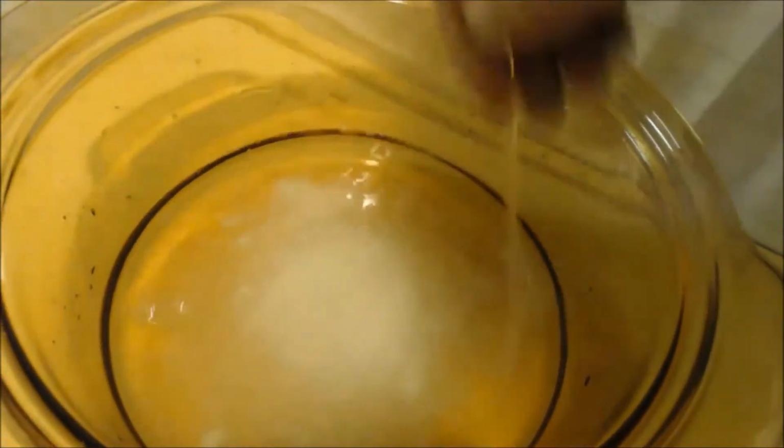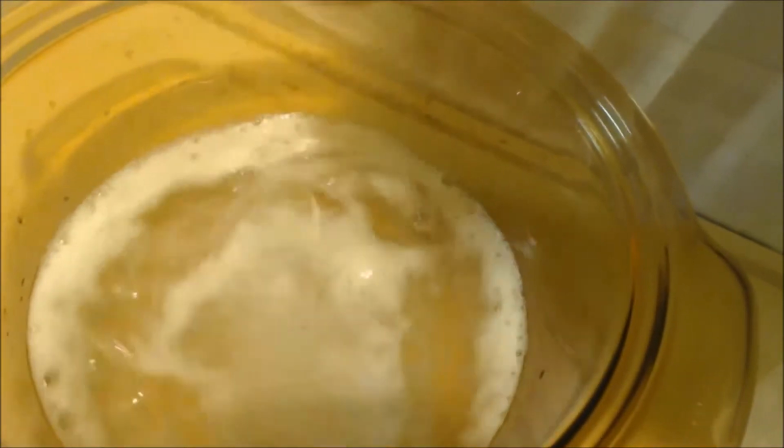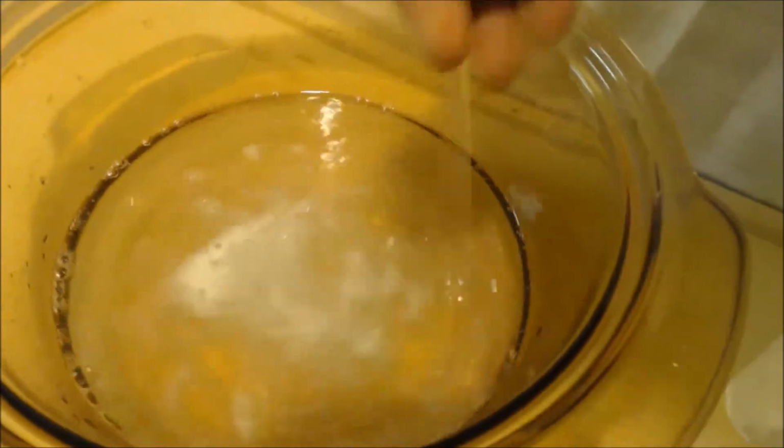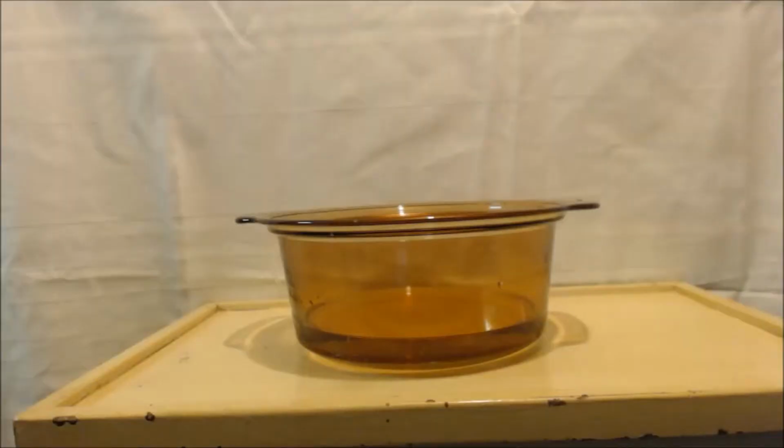Wow, this is starting to make me think there's sulfuric acid in here. It is still going strong. I barely have any stuff left to throw in here. I'm just guessing, but the first time, I started out with a pH of 2. I threw in about 20 grams, which is half of what I had, and the pH went up to a 5. I threw in another 10 grams, so that's 3/4 of what I had, and now the pH is up to about a 7.